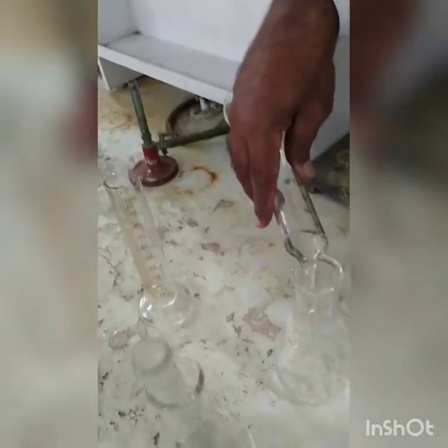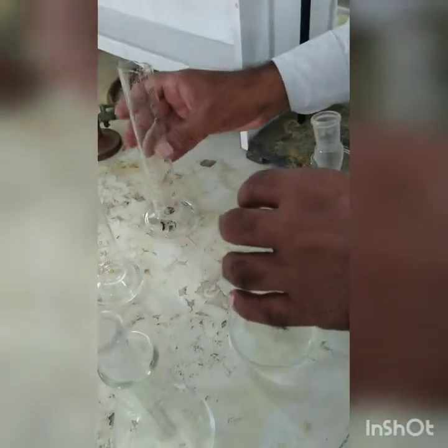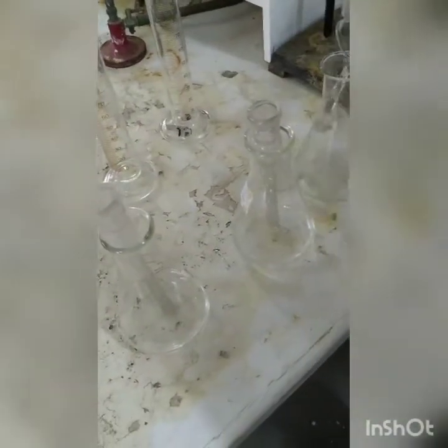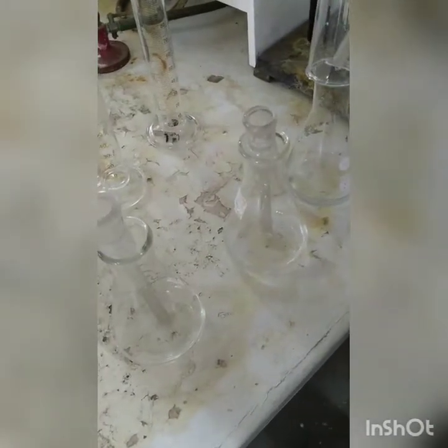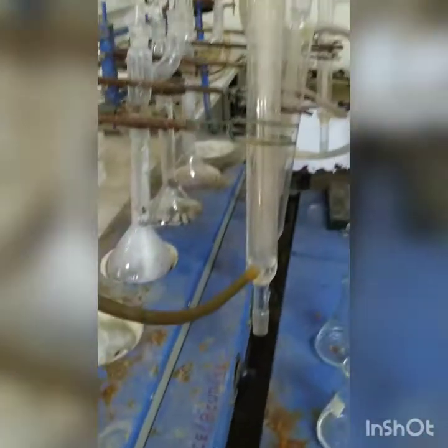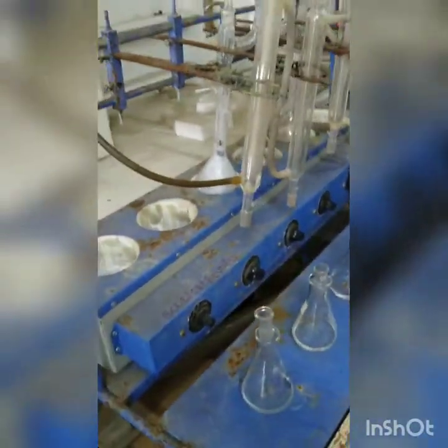And the reason why we do this is because then the nitrogen doesn't get expelled out in the air, it remains in the solution form. So these three distillate collection assemblies for our 3 distillation flasks are filled with 50 ml of 2% boric acid solution. Now we are going to transfer this below the distillation assembly to collect the distillate.